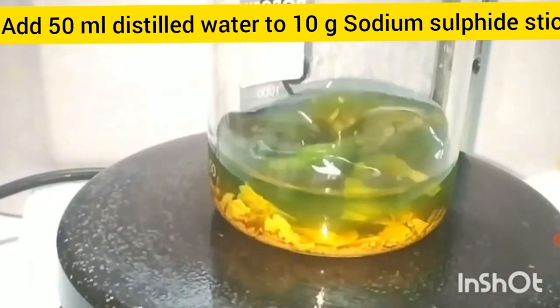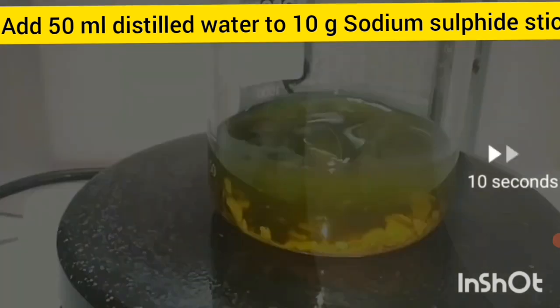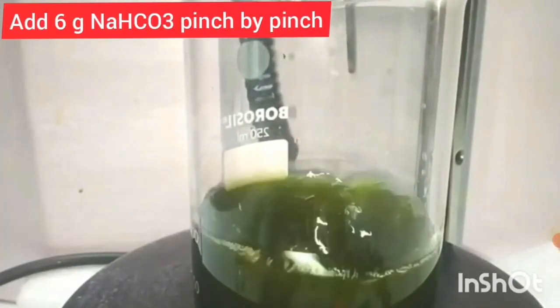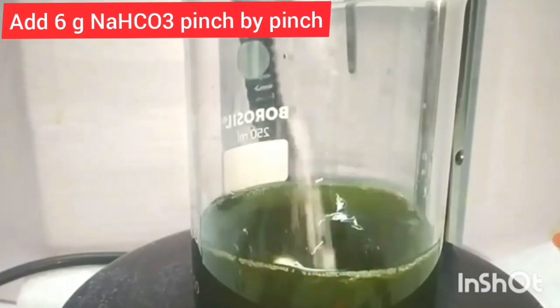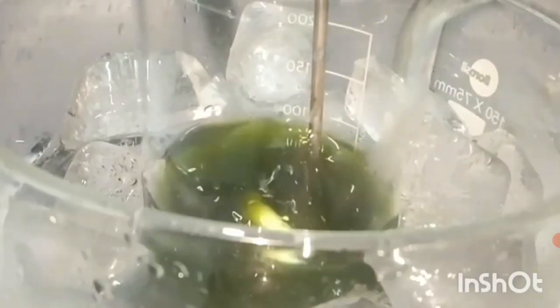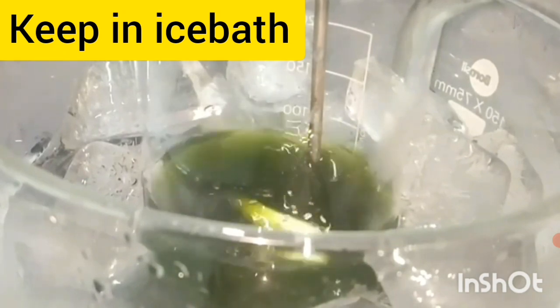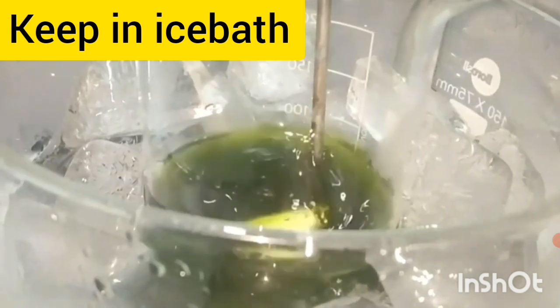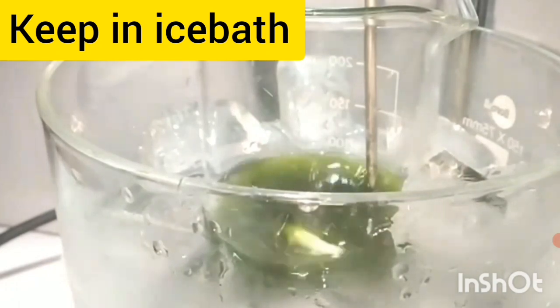50 ml of distilled water is added and stirred well. Then add 6 grams of NaHCO₃ pinch by pinch so that Na₂S (sodium sulphide) will be converted into NaSH. The mixture is kept in an ice bath to ensure complete conversion to NaSH.